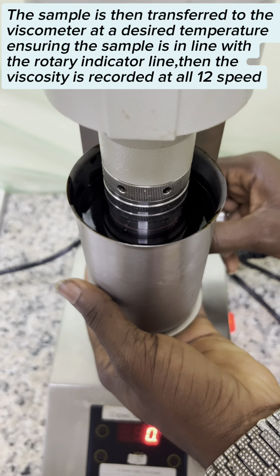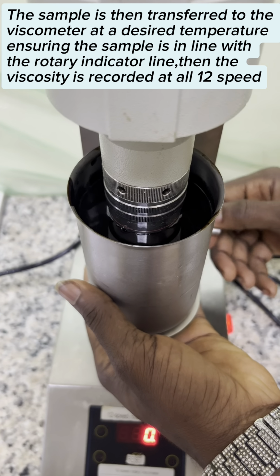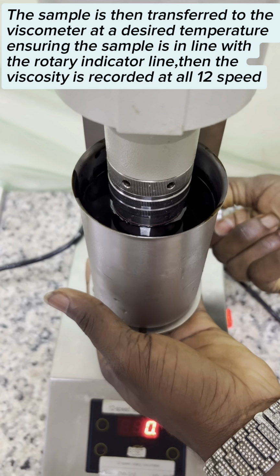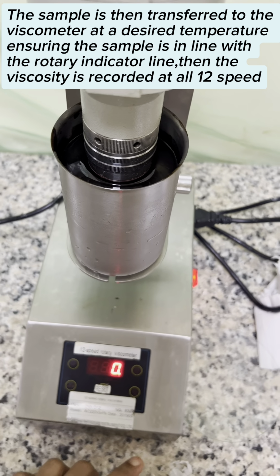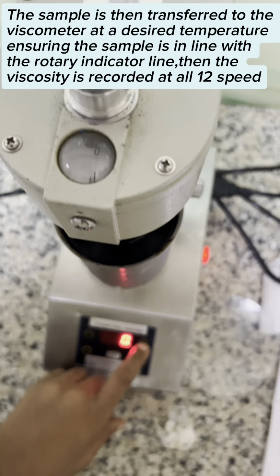The sample is then transferred to the viscometer at the desired temperature, ensuring the sample is in line with the rotary indicator line. Then, the viscosity is recorded at all 12 speeds.